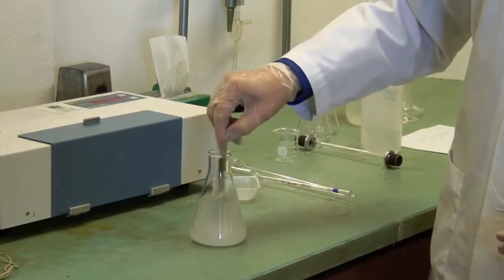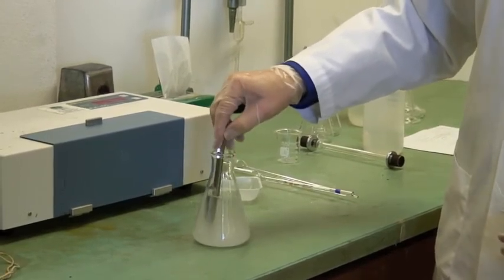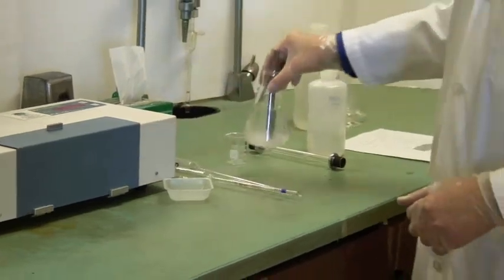Now while we're waiting for that dissolution to happen, let me talk a bit about the instrumentation that we've got here.